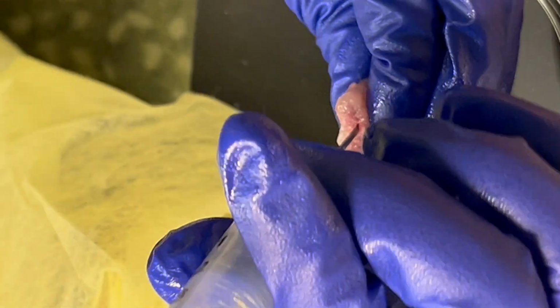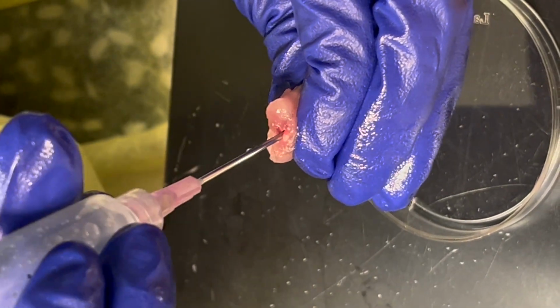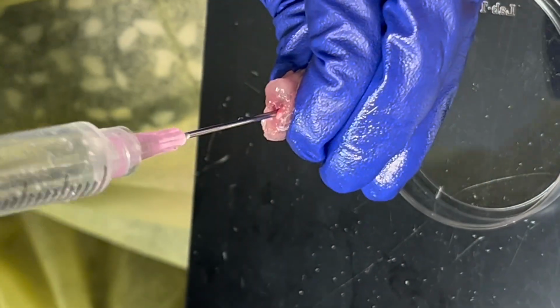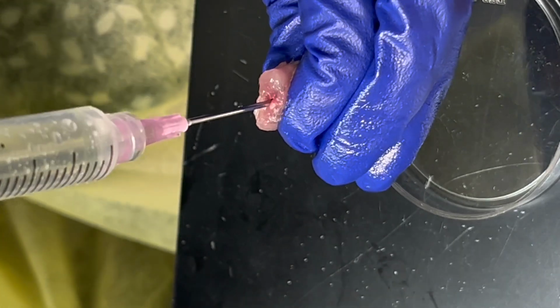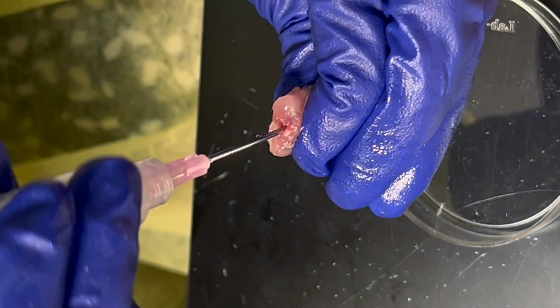You don't see the bevel of the needle anymore, right? And maybe a little bit more. I'll try going almost like a screwdriver rather than pushing it, because remember it's muscle or tissue. If you try to push hard, it's simply gonna perforate either your finger or the tissue itself.